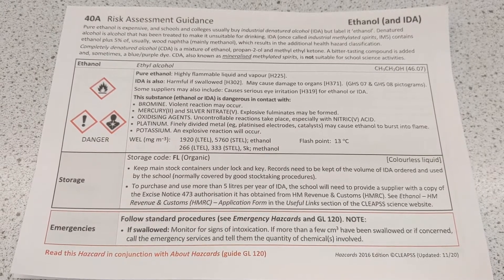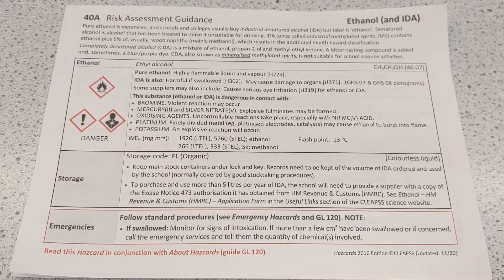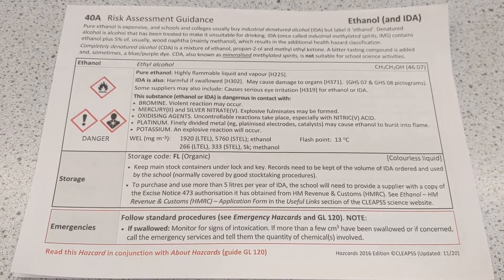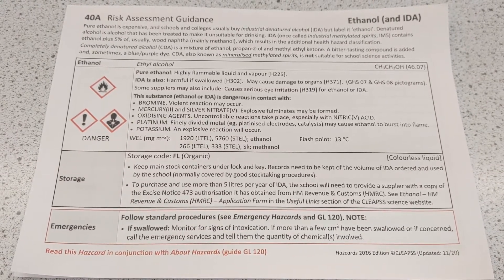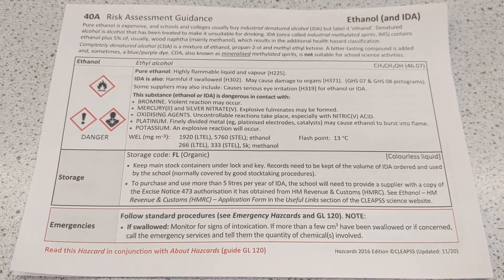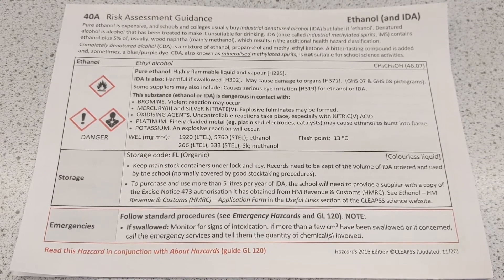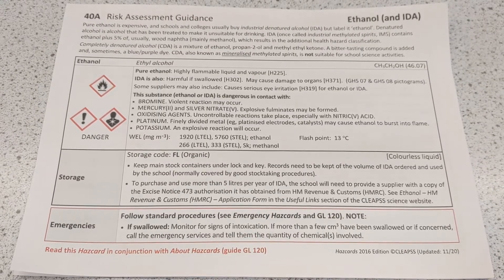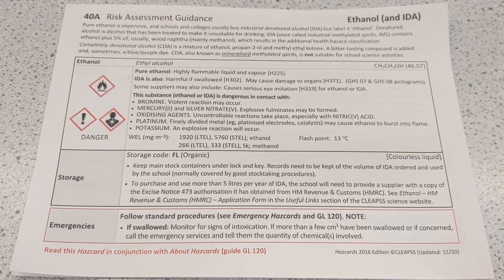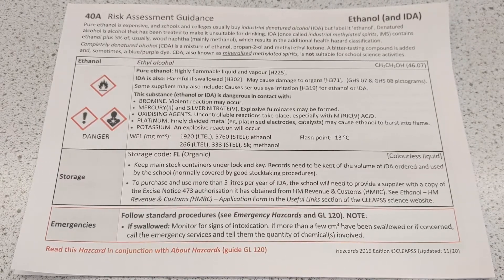Here we've got some risk assessment sheets for the alcohols we'll be using. It's important to carry out risk assessments before conducting any experiments so we're aware of the risks and hazards and how to minimise these risks.